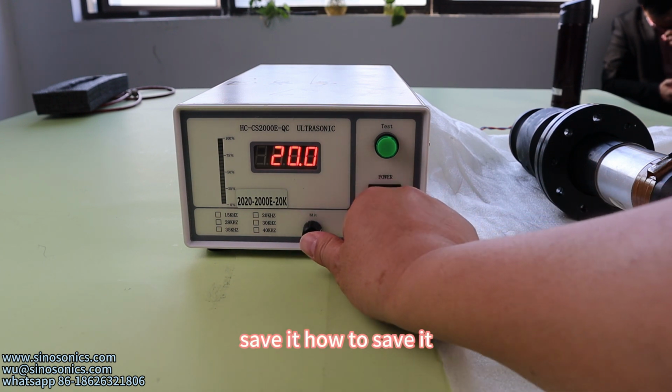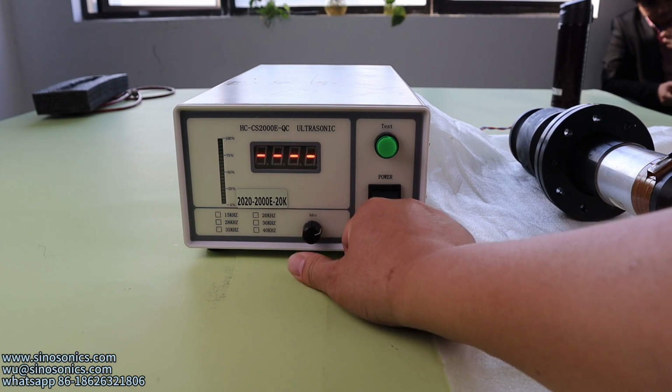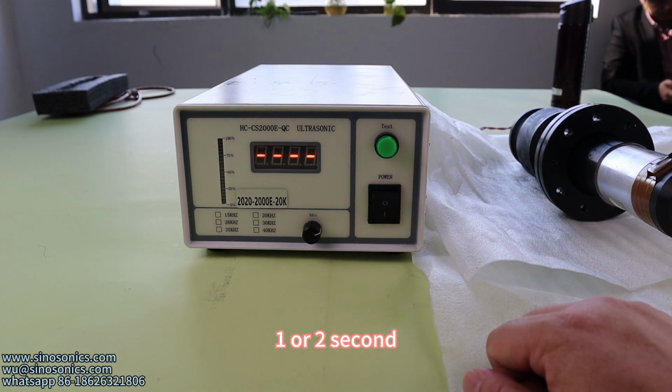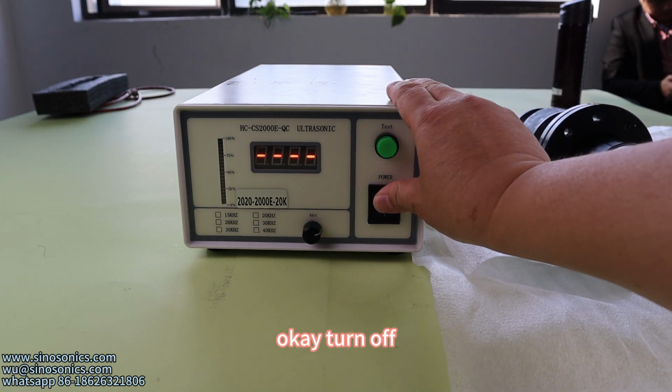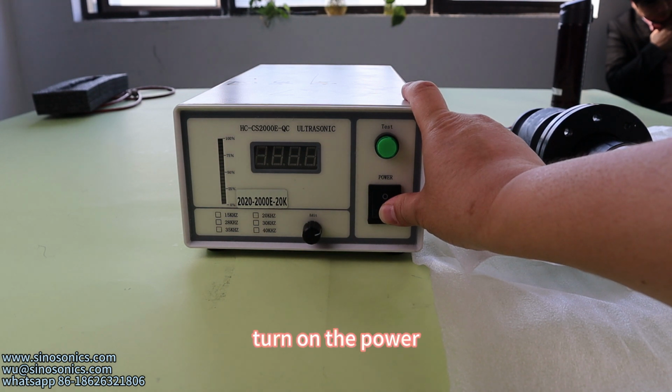Save it. How to save it? Press the edit button for 1 or 2 seconds. Turn off. Turn on the power.